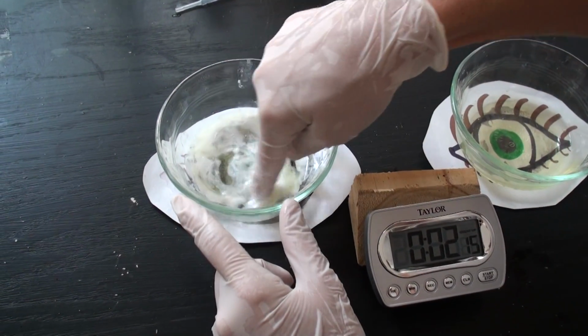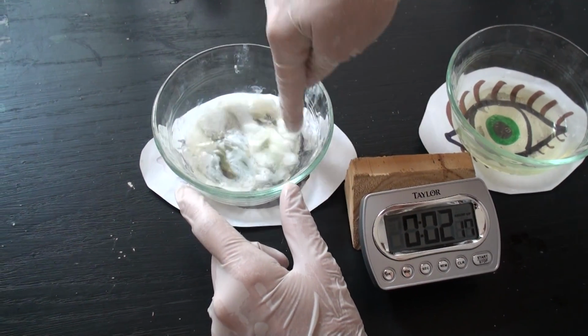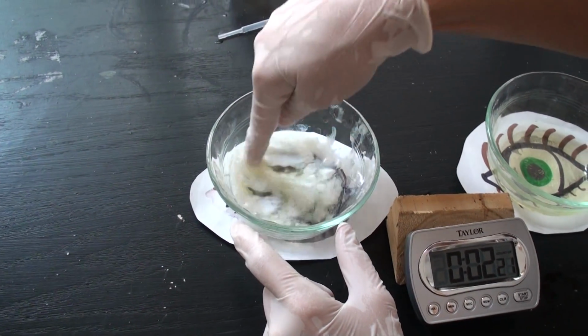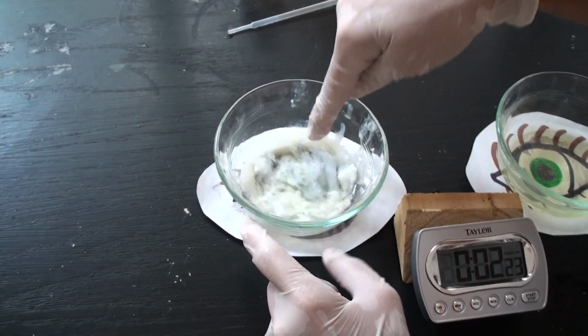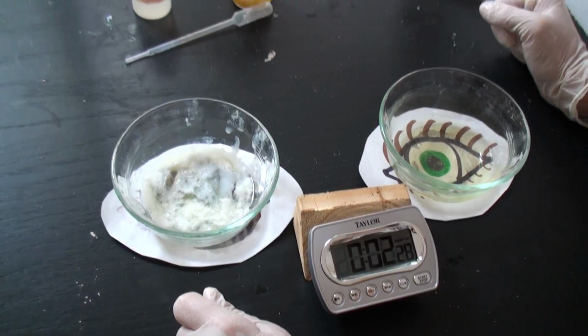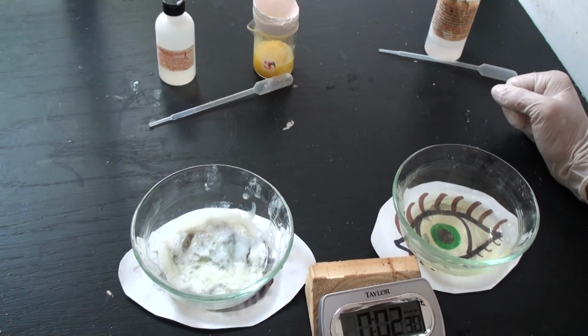Not wearing safety glasses when you're dealing with acids and bases can cause permanent detrimental effects to your vision and your lifestyle. So always wear your safety goggles in class and enjoy the chemistry lab.